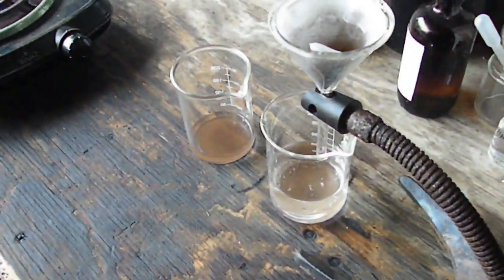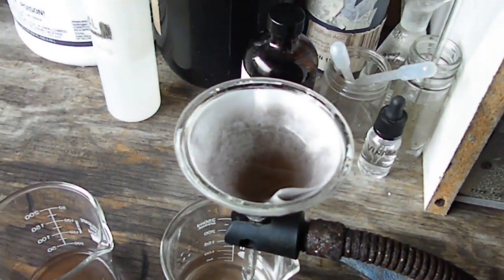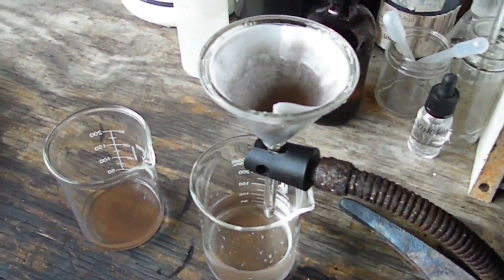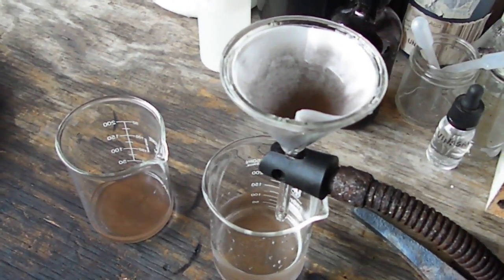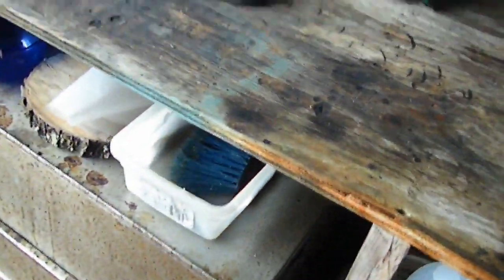I would have thought it would have been a little more clumped up because there should really have only been bond wires left in there. I'm guesstimating — I can see some other little contaminants just by the color. So what I'm going to do is go ahead and filter this off, then put it in our covered dish here. We're going to burn off the filter paper and see what we get out of it.